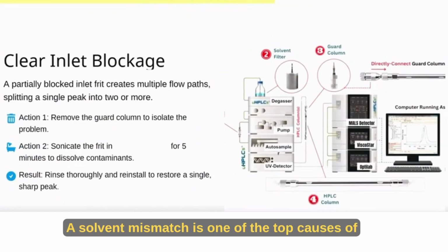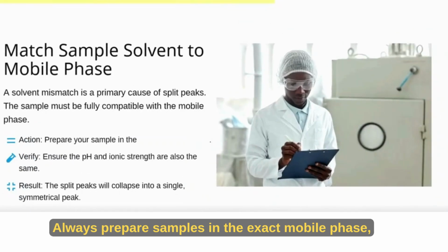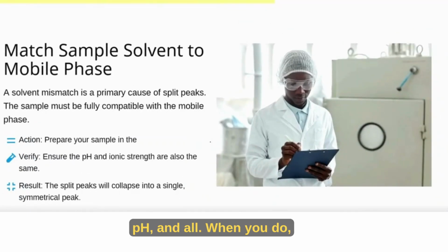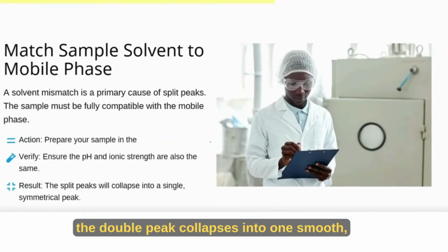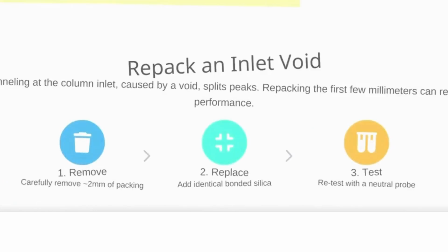Match sample solvent. A solvent mismatch is one of the top causes of split peaks. Always prepare samples in the exact mobile phase, pH and all. When you do, the double peak collapses into one smooth, symmetrical peak.